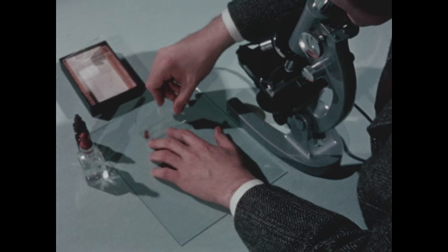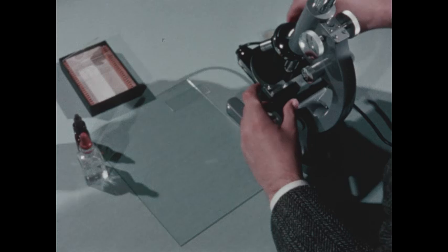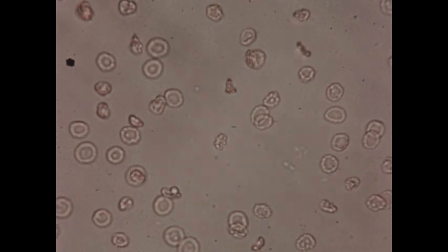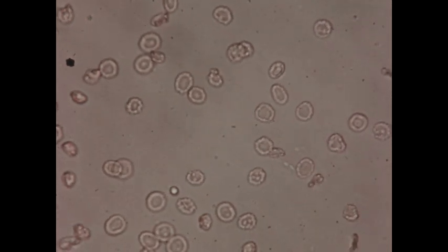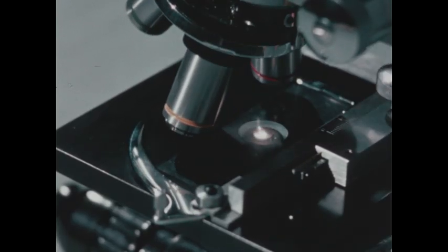We can illustrate osmosis in a living cell with the aid of some red blood cells viewed under a microscope. The concentration of materials in the water outside the cells is almost the same as inside. There is osmotic balance. We can upset this balance by adding a drop of distilled water.